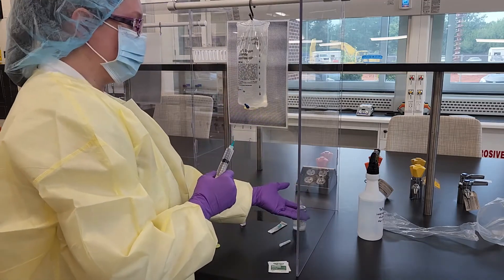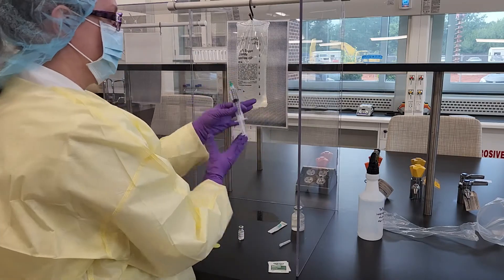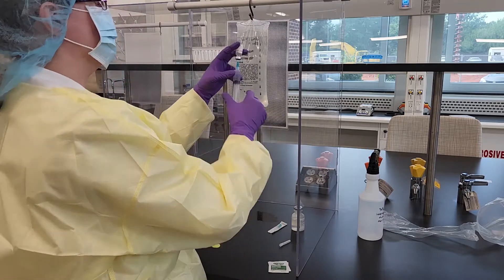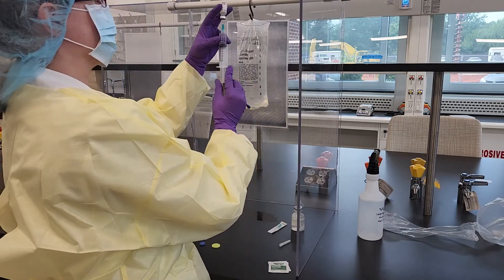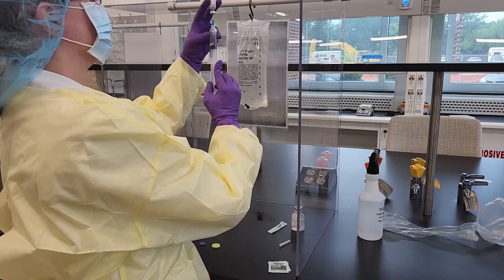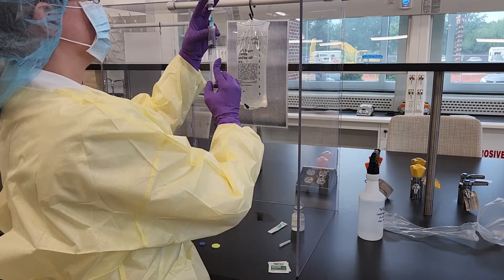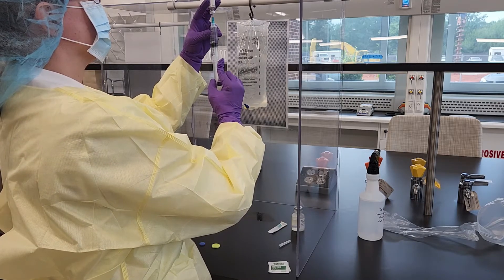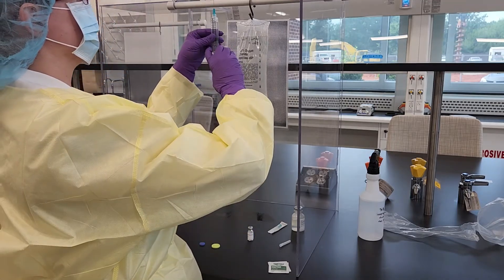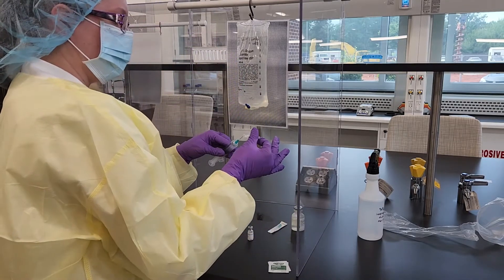So you're going to pull up as much as you need of the initial ingredient. We are then going to add the second ingredient. In this particular example, I'm going to need all two milliliters that are actually in this vial, so I'm simply going to add that. We're going to make sure we don't have any bubbles in the syringe. I'm now also going to replace my needle.